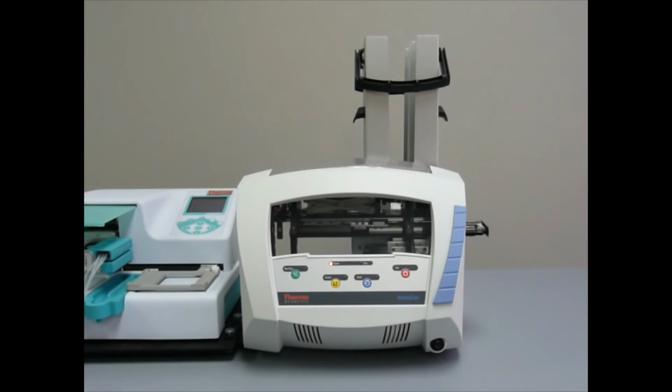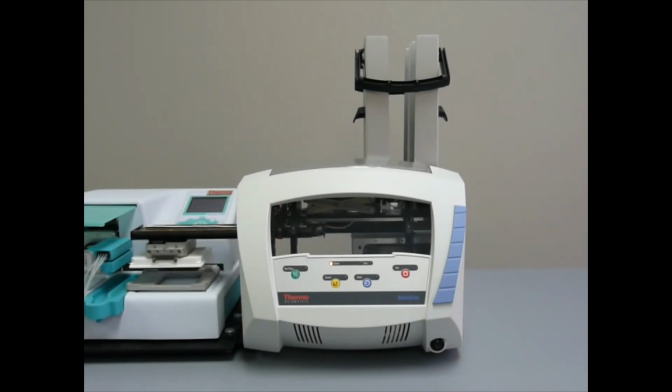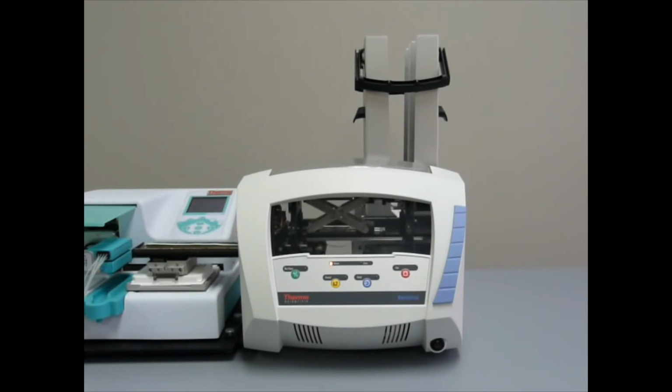First thing we need to do is get a plate. And we're going to move to Safe 1. As you notice, the arm is above the instrument nest, up and away from anything that it could collide with. So that's the safe location. Next we'll go to Instrument 1. You can see the plate fits perfectly into the nest there, and that's a well-taught location.